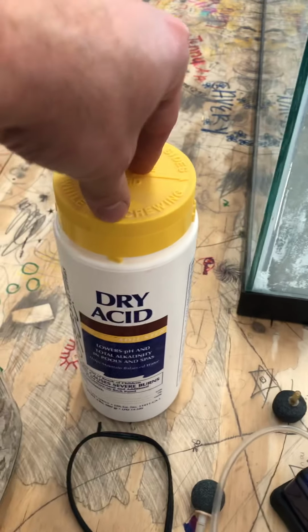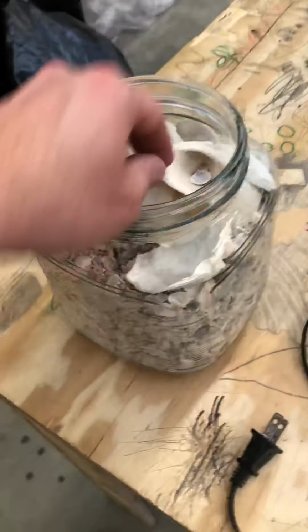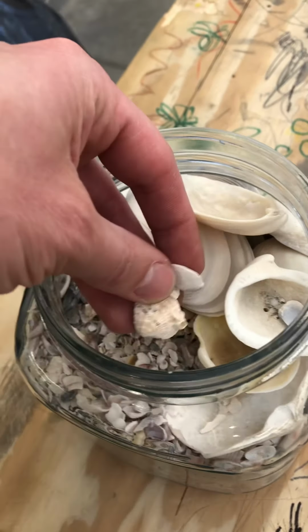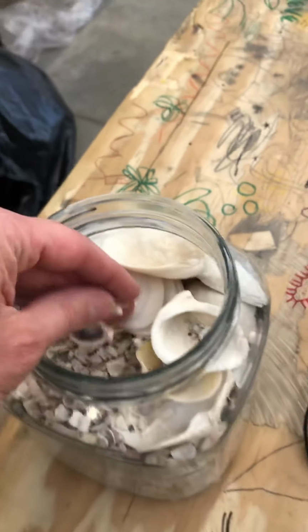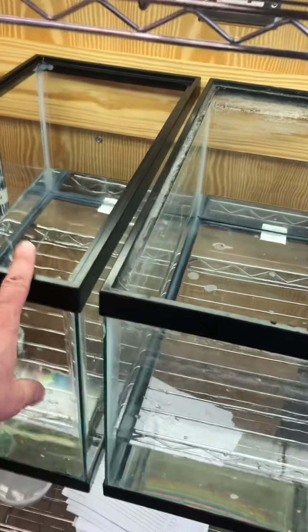I have some dry acid, so we can add it to the water to change the acidity if carbon dioxide doesn't work. You're going to need some shells, and try to find ones of various sizes, but also similar, so that you can mass them. You're going to need some smaller tanks or vessels with similar quantities of water, like we have here. The light isn't necessary, but you want at least one you can have as a control, and maybe two others, so you can change the pH of those.